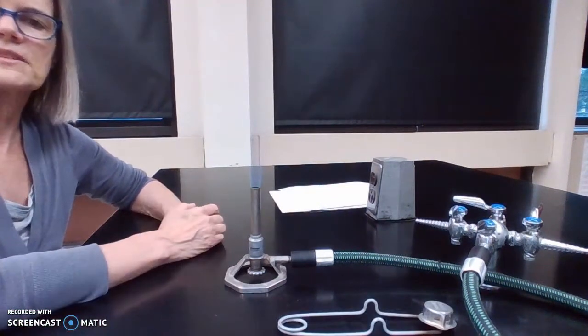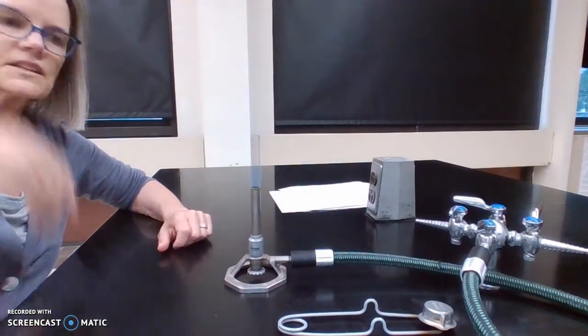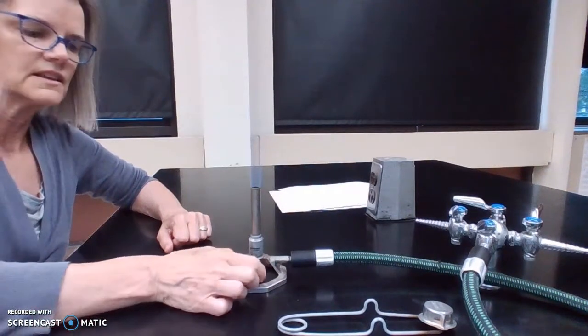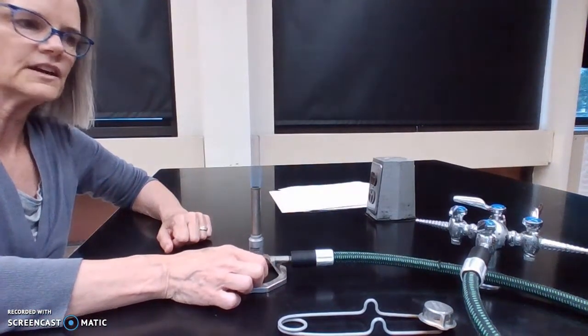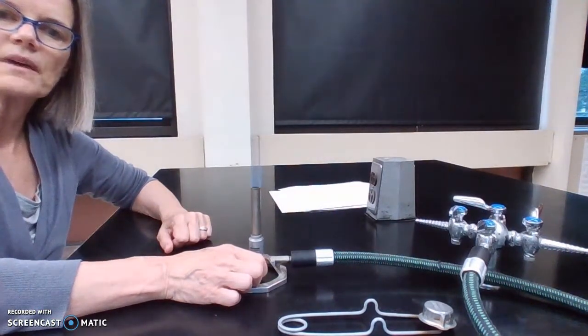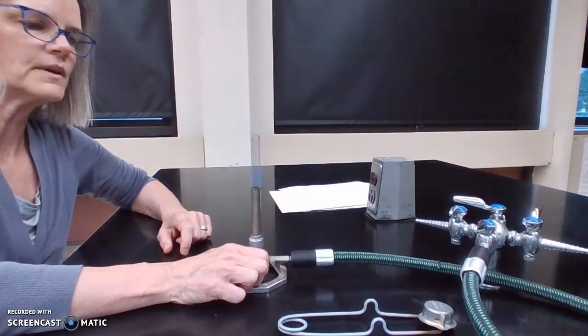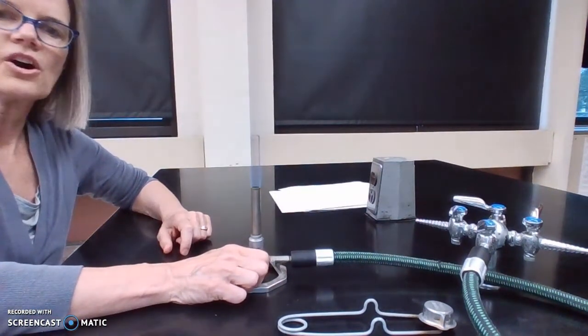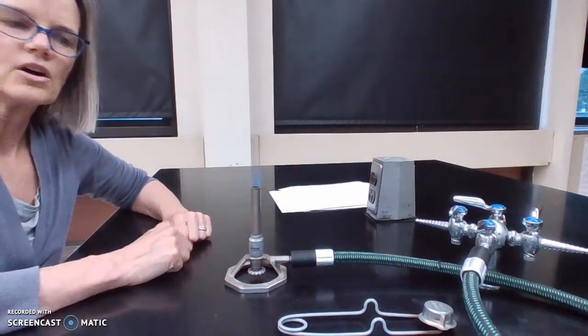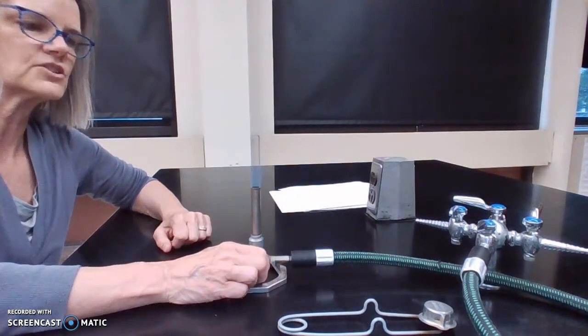What I notice about this flame is it really could be a better quality. First of all, it's pretty high. It's all the way up to my forehead. I'm going to use the needle valve down here, and I'm going to turn that and close it some. And that's going to make my flame smaller. So if my needle valve is too open, the flame is too tall. If my needle valve is too closed, my flame is too small. I want this kind of intermediate, maybe about a three, four inch tall flame.